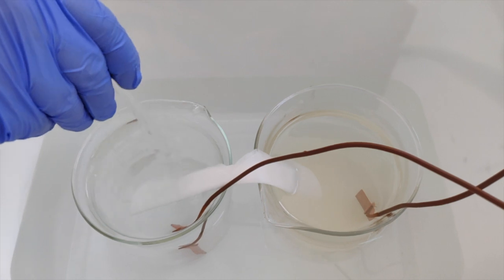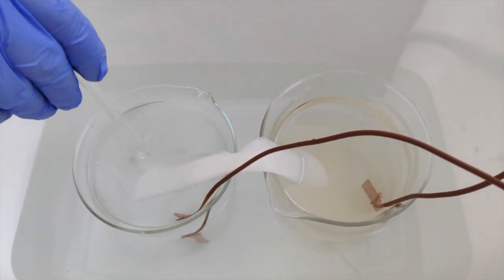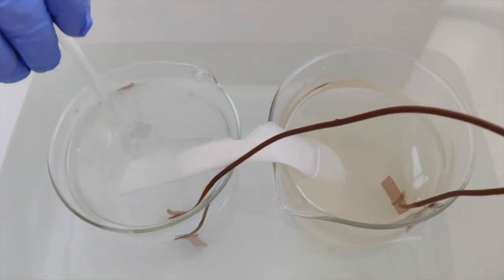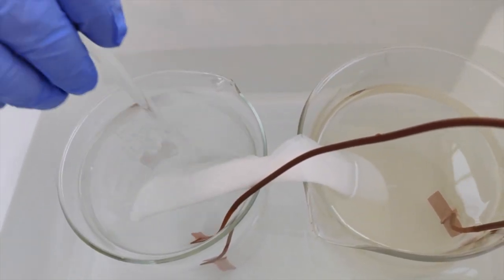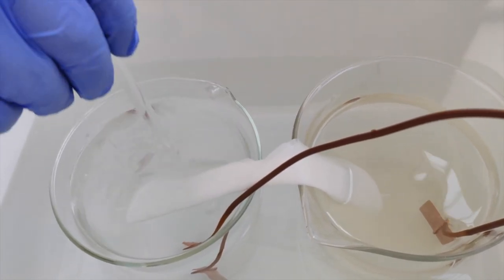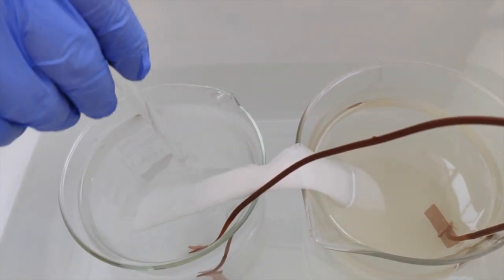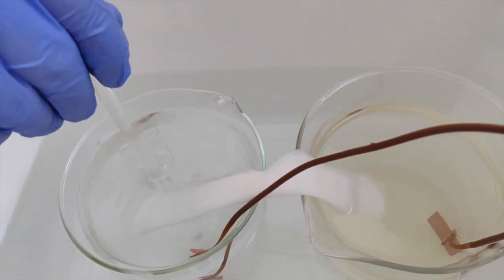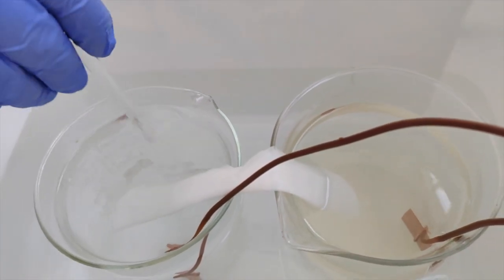From our voltage results of the first experiment, we noticed that the voltage values range from 0.002 to 0.026. The concentration of sodium chloride in water does not affect the pH of the solution. The concentration of copper was considered negligible with respect to pH change. Therefore, using a Pourbaix diagram, we have found that we are always in the corrosion region.